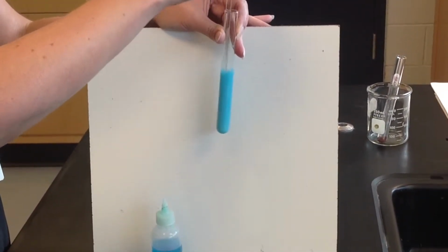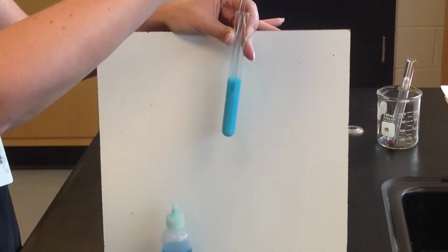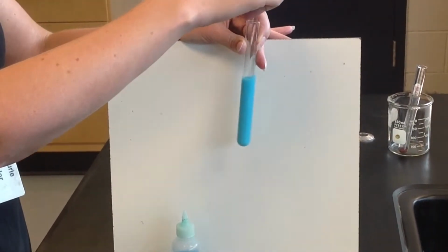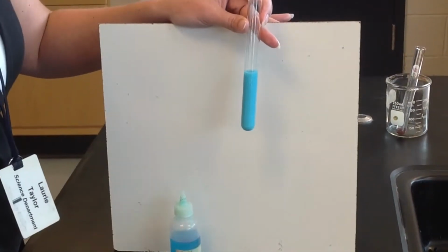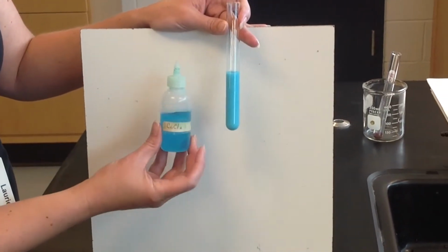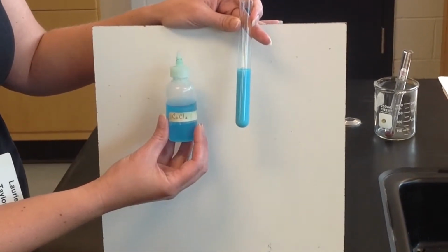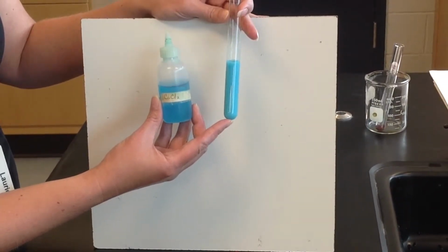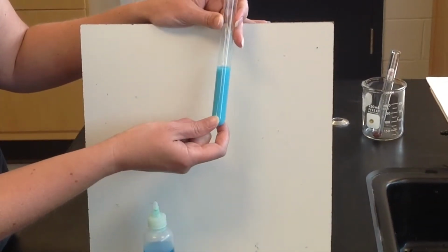We may have to let this sit and come back to it after we do some of the other explanation. But you can definitely see some of these solid particles sticking on the side of the test tube. So this is a precipitate formation. I think you can tell from the reaction that the precipitate is a blue color. And if you use your context clues, if the copper solution is blue and we formed a blue solid, you may guess that the copper ions are now in the solid, and you would be right. We'll talk about that in just a minute. So we'll let this sit a little bit and come back to it after we go through the whole explanation.